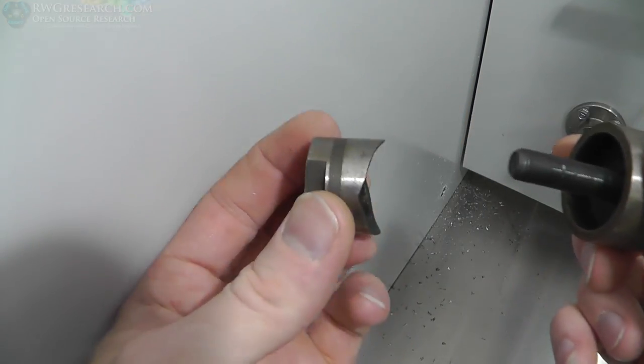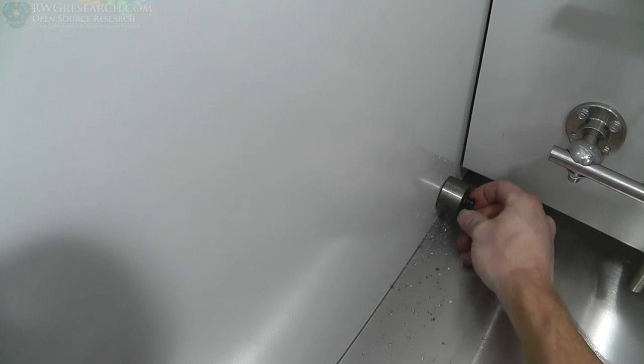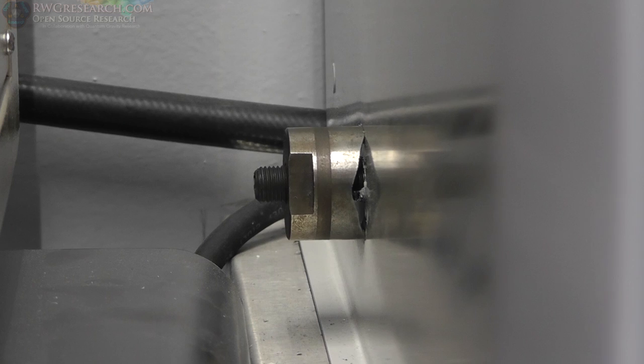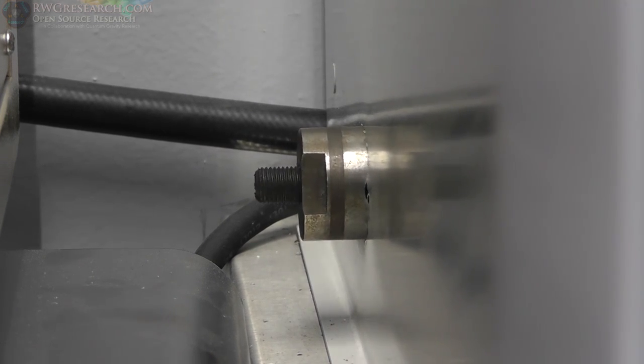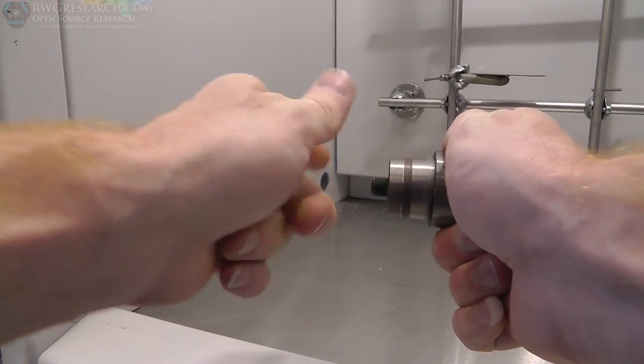Okay, so what you're gonna do is this piece goes on one side, this piece goes on the other side. So we're gonna put this here so I can get to it easily, and this one out here. All right, so let me set up the camera on the outside so you can actually see that thing cut. Here we go. And that's how that's done. It is just that simple.